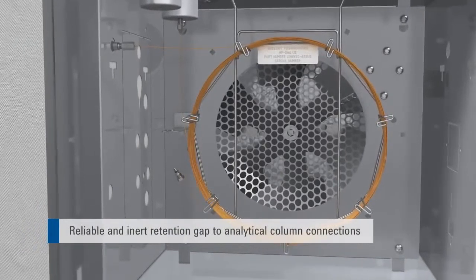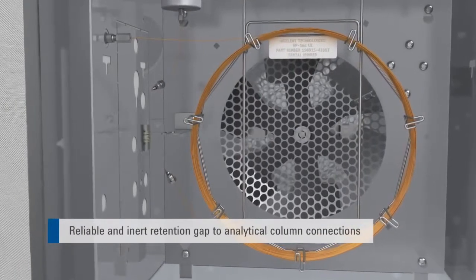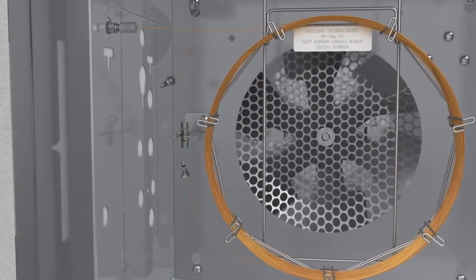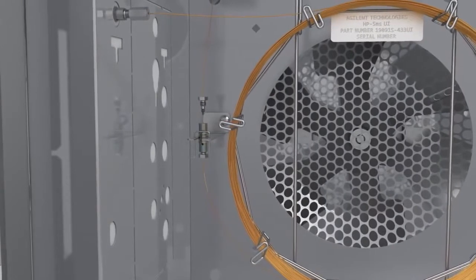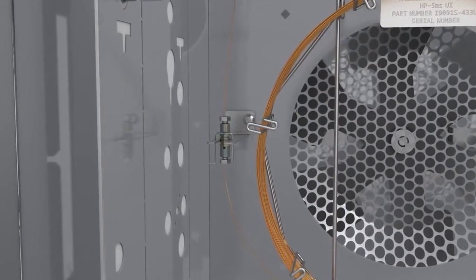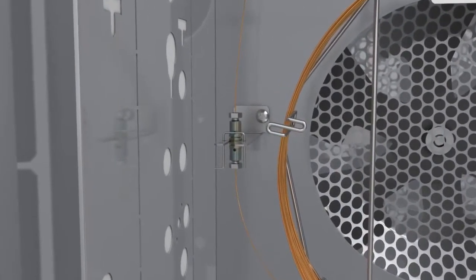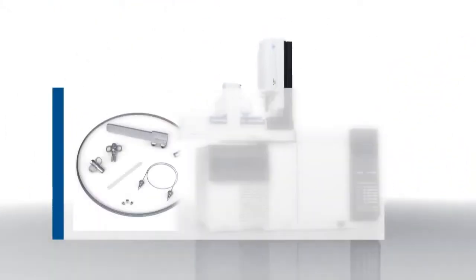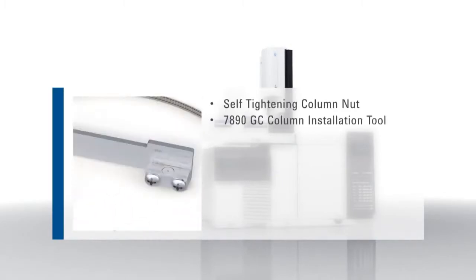Ultimetal Plus flexible metal ferrules connect retention gaps with analytical columns using the Agilent Ultimate Union. Because the sample is exposed to the surface of the ferrules, the Ultimetal Plus deactivation of the flexible metal ferrule is critical for recovery of active analytes. When using an Ultimate Union with flexible metal ferrules, robust, leak-free and inert connections are made when using retention gaps or guard columns. With these innovative tools, all chromatographers can install and maintain proper GC column connections, easier, faster, and more reliably.